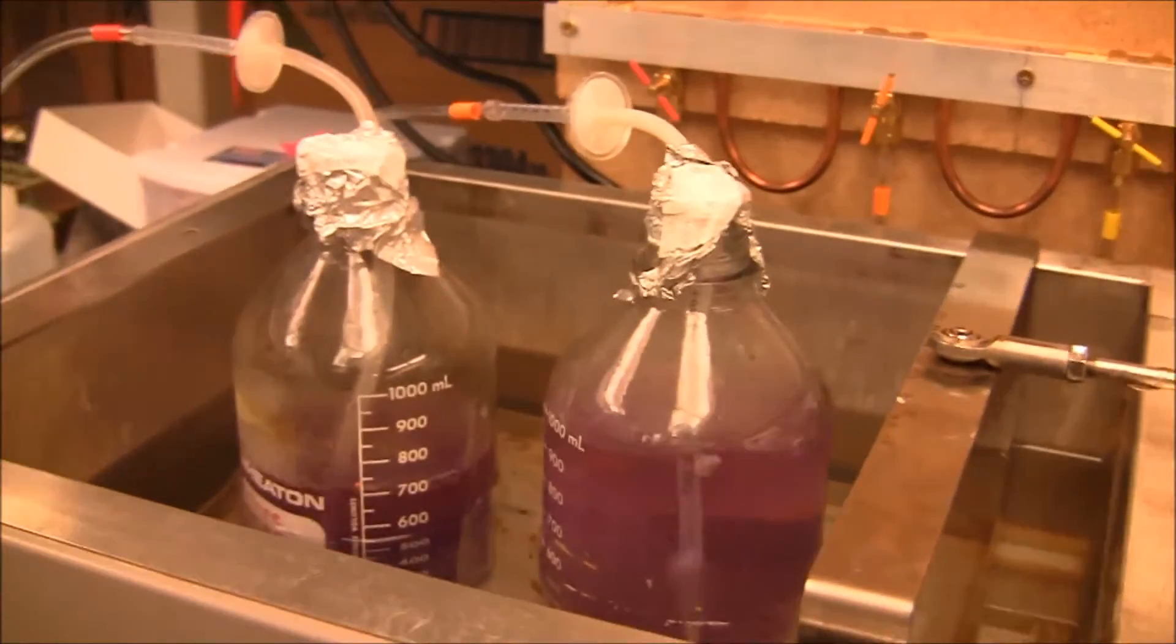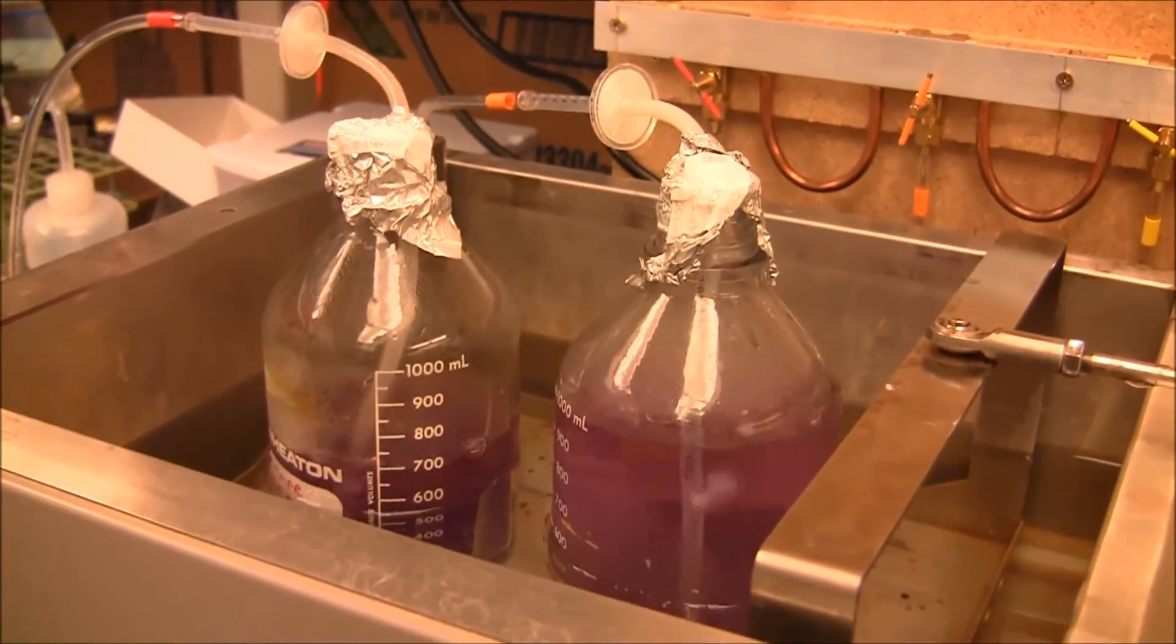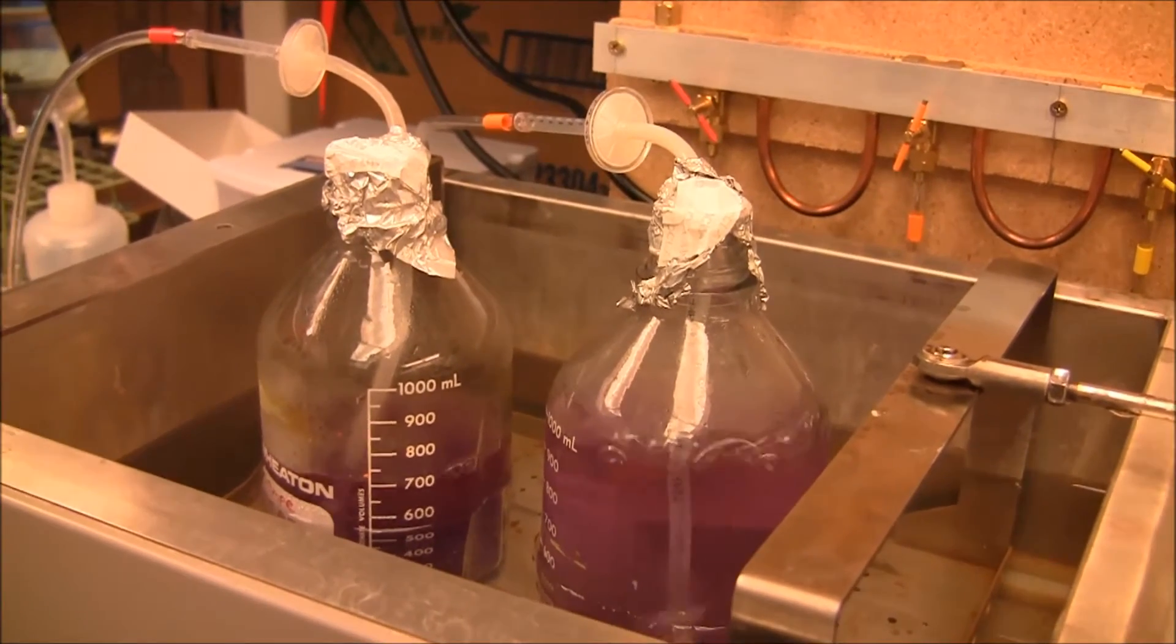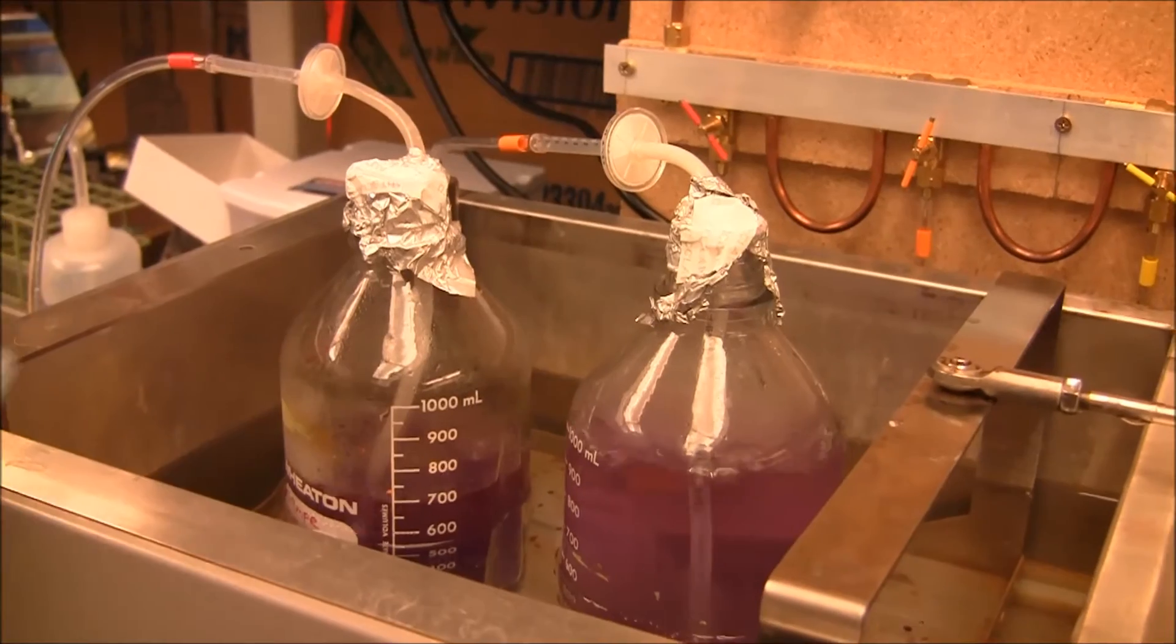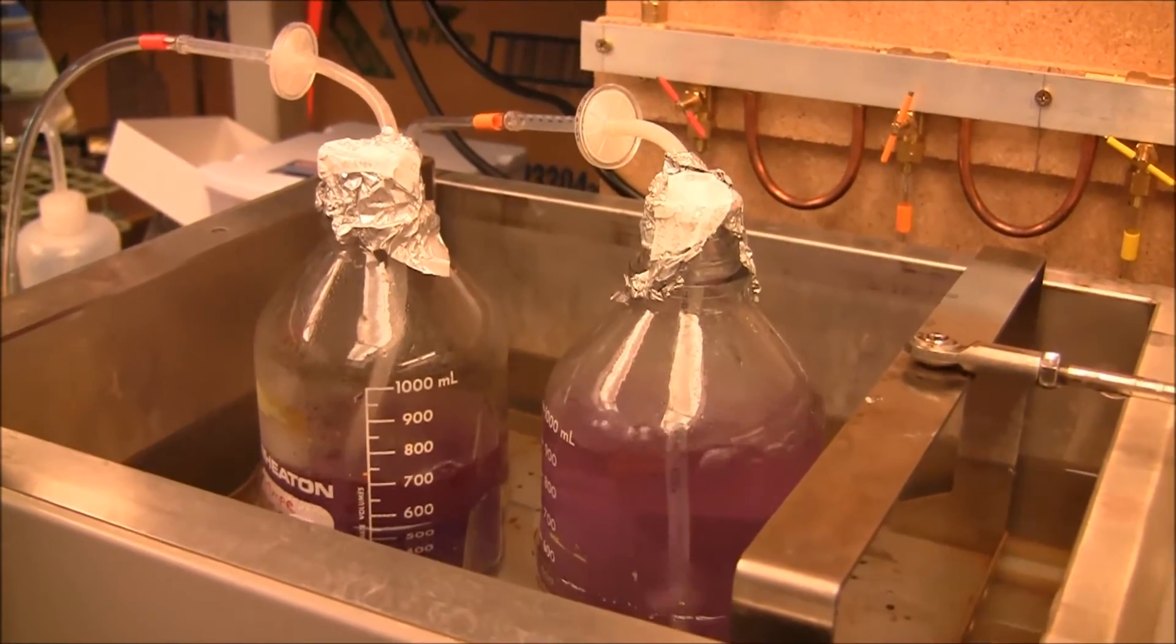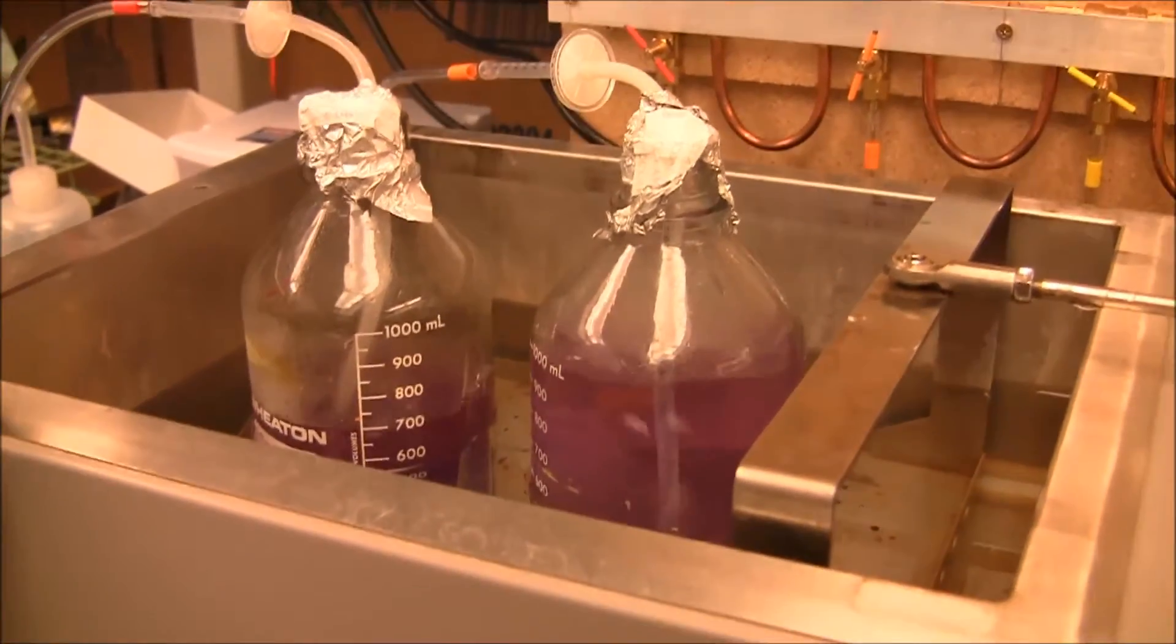So in a few minutes, or actually more like 20 minutes, the color will change and it will be almost transparent and then we'll show you the end result. Thank you, Seth. We will come back in 20 minutes.